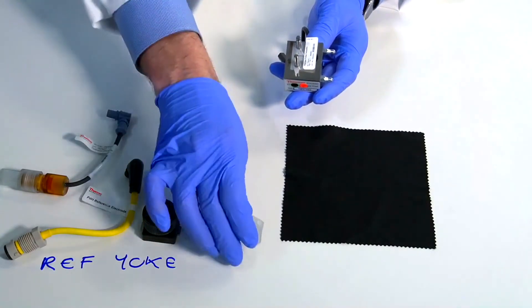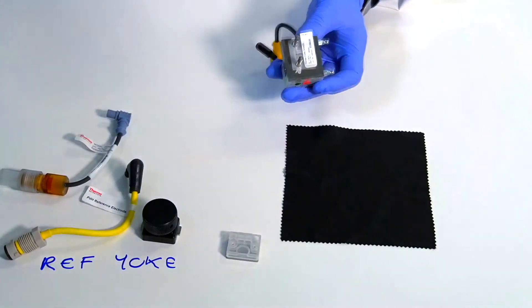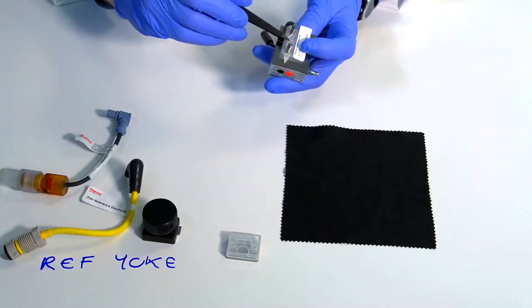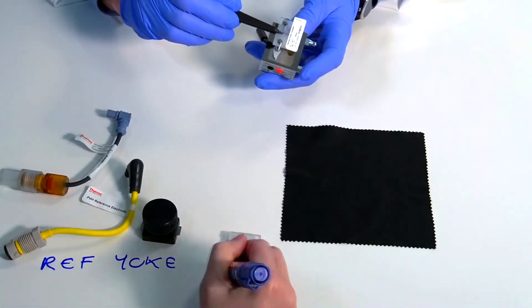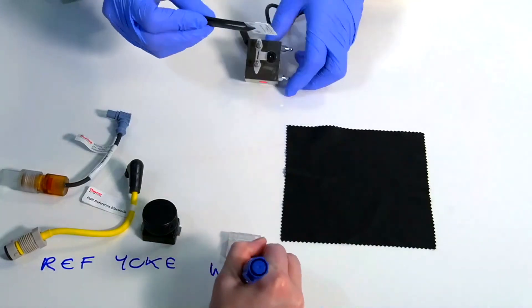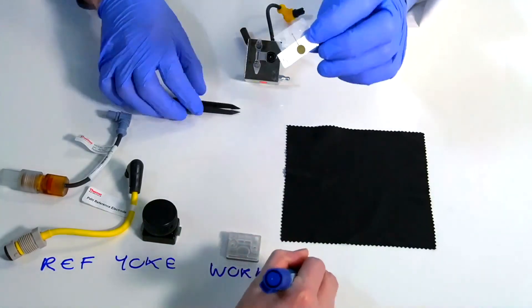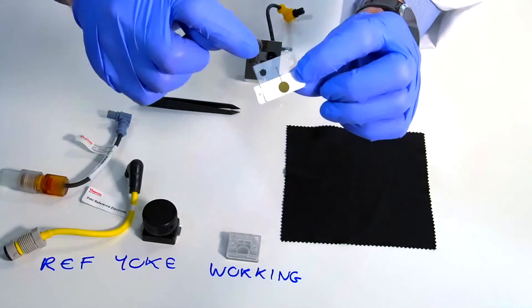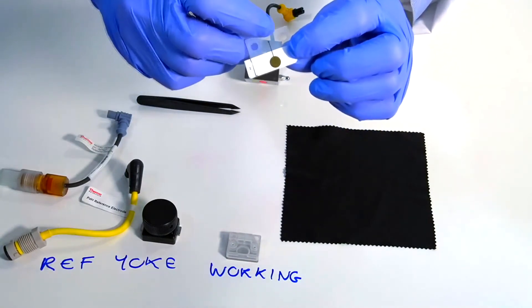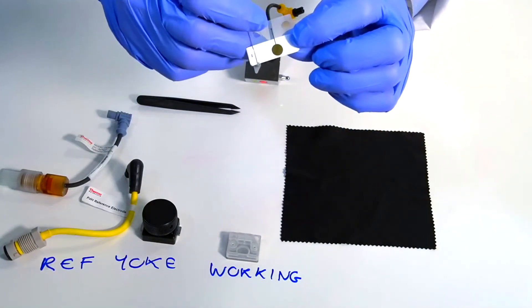The actual electrode itself, because it's a disposable one, is just printed onto this sheet that I'm removing here. You can see here the gold is printed onto the sheet. It's the very small spot at the end of that track that's the actual part where the sample flows over and where the reaction happens.